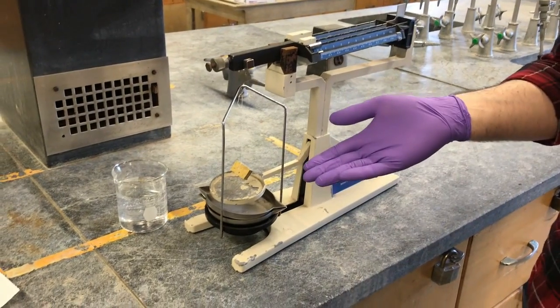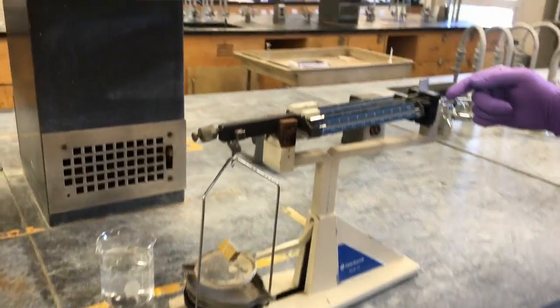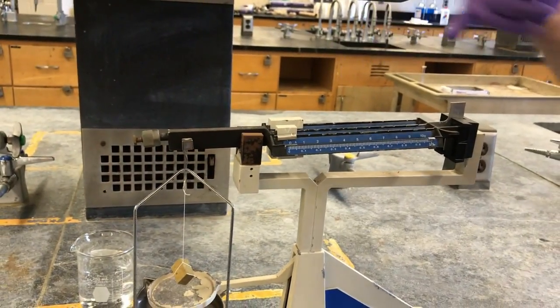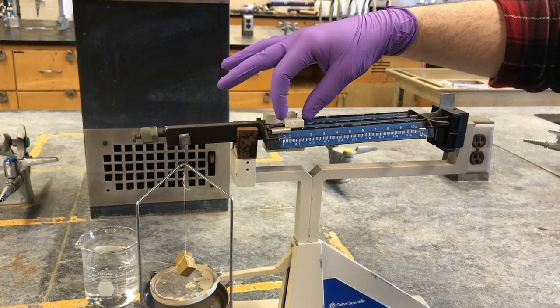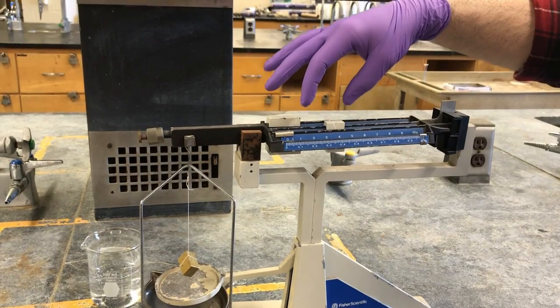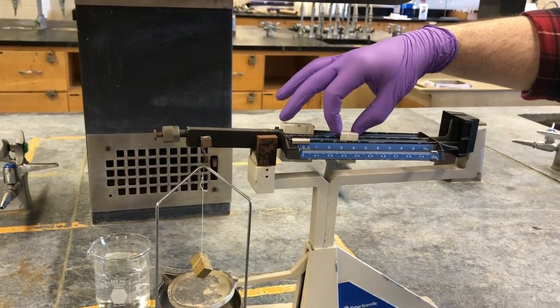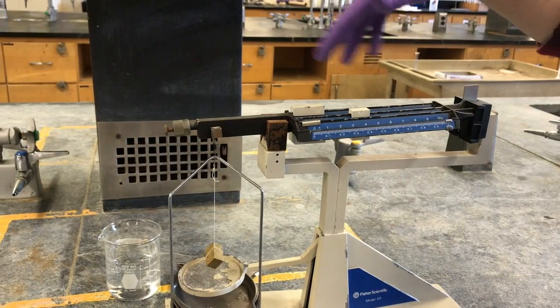So once you have your metal hanging at a proper level, you'll notice that now these lines are no longer against each other. So we're going to have to adjust the mass of this triple beam balance to get them aligned again. So let's try that out. We've taken the mass of this on the balance, so what was that, 47? Good thing we wrote it down. It is close to 47. Okay, so that's where we're going to do the ballpark area.